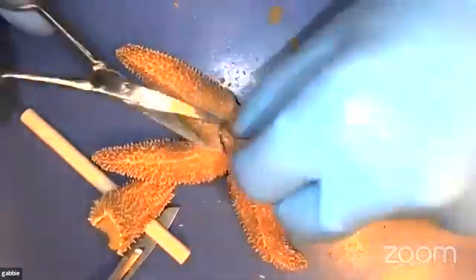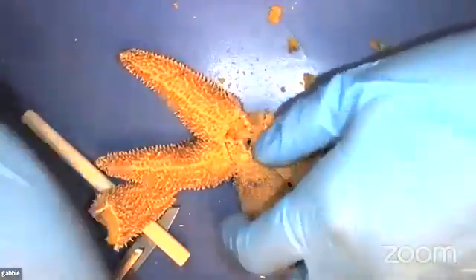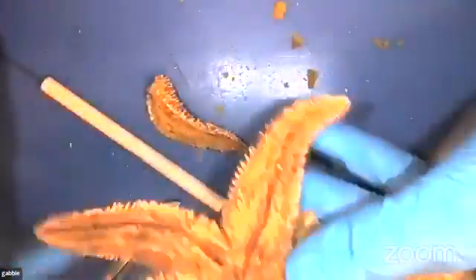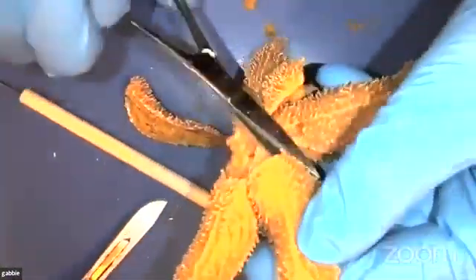And I'm going to see if we can see a little bit of that cardiovascular, or sorry, that water vascular system by the madreporite. Perfect. So if you can see that little tube right there, that helps bring water in. So it's bringing water in through the madreporite into the mouth, brings it all throughout the arms to fill the tube feet, throughout to the digestive glands to help get oxygen in the body. And then there's one more feature inside of the sea star that I'd like to show you.